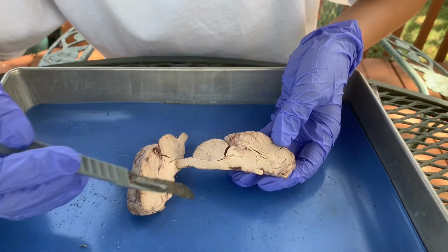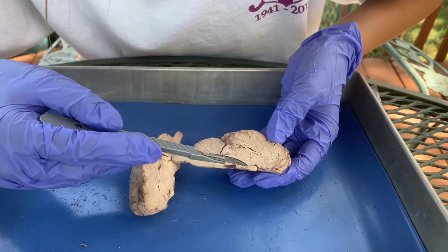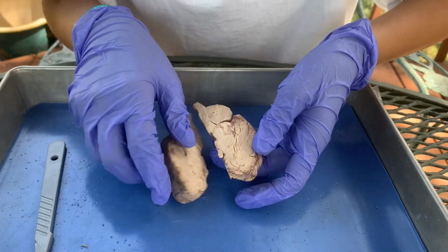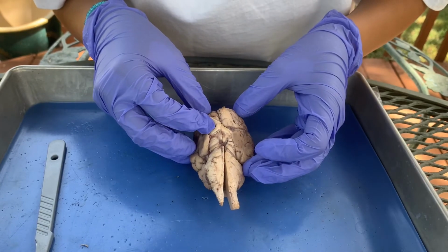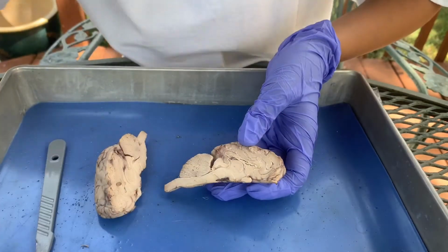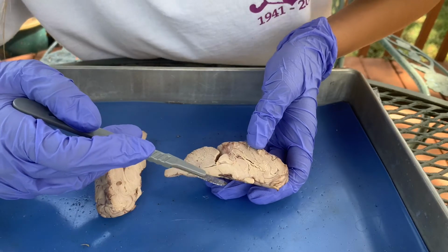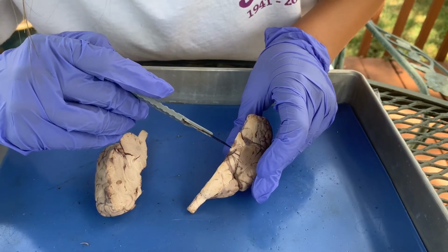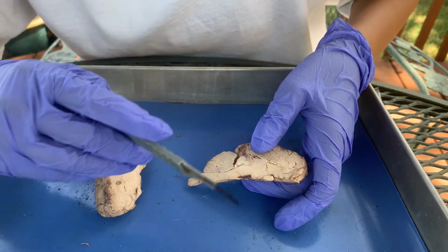This structure is a part of the optic chiasm. You can see that right here, and that's the hypothalamus and then the optic chiasm. If you put them together, it forms that optic chiasm I showed earlier, where the optic nerves branch out from that cross-like structure. Additionally, right by the optic chiasm, there's the mammillary body right here, and the stuff in between is the hypothalamus.